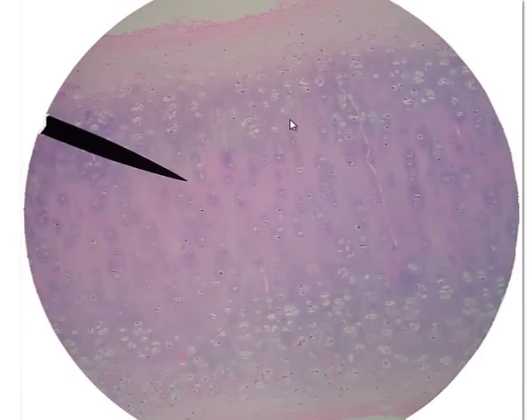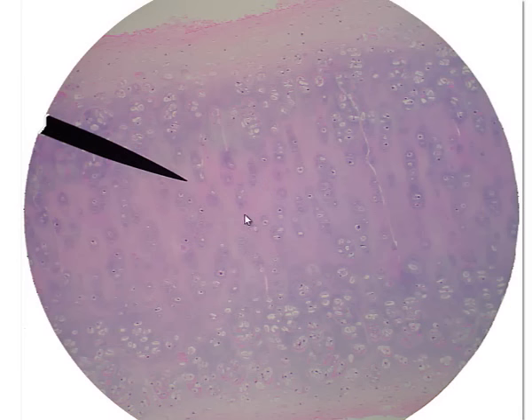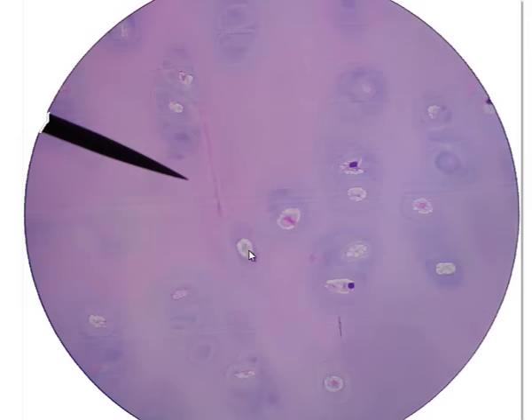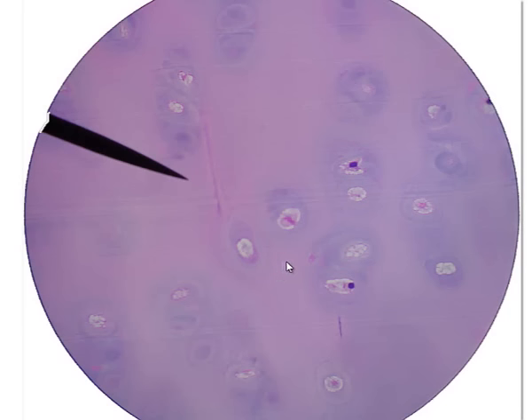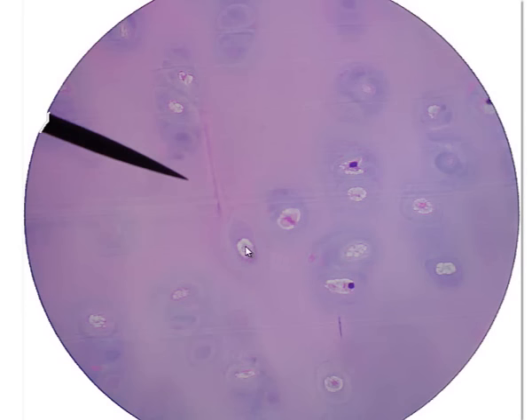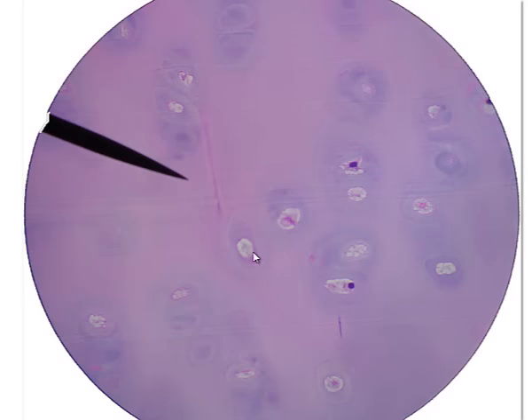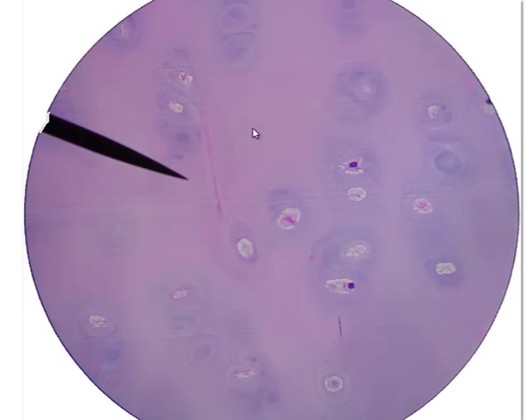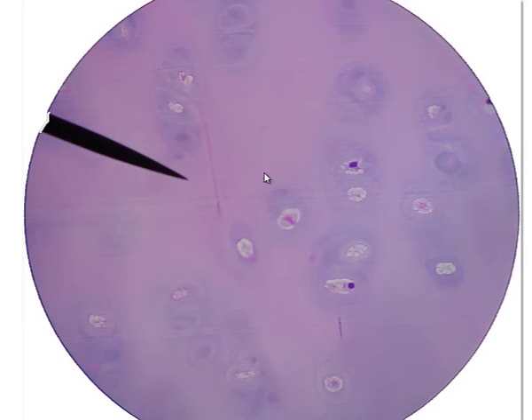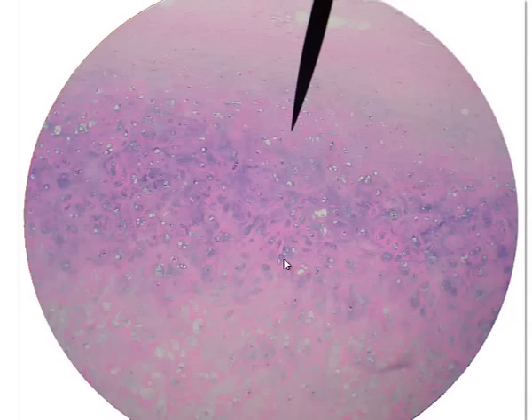Here again is hyaline cartilage — this one is human, from a trachea. We see the cells in their compartments separated by this smooth-looking extracellular matrix. Higher magnification confirms: hyaline cartilage has cells separated by a smooth extracellular matrix. A helpful mnemonic: hyaline cartilage is often stained with a light purplish appearance, and one of my students once said it looks like grape soda. So when it looks like grape soda, think hyaline cartilage. The major features are compartments with cells and a smooth-appearing extracellular matrix.